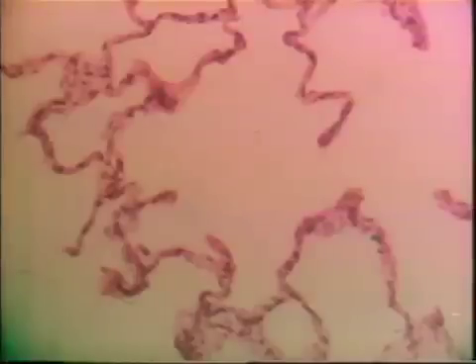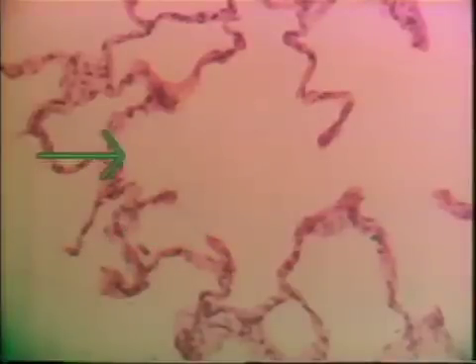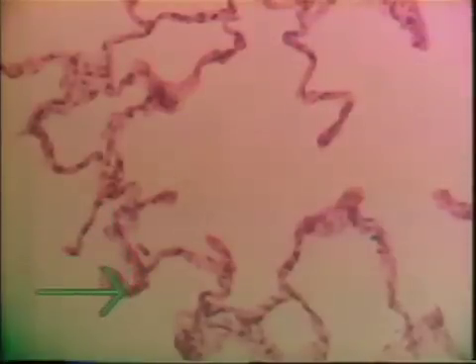At higher power, let's look at the epithelium of the alveolar sacs themselves. These are alveolar sacs, and you have to account for the lining epithelium which is now squamous, and the endothelial cells — because we have capillaries now. The epithelium of the respiratory system is on the periphery, with a huge capillary network in between these endothelial cells. There are also some macrophages and septal cells. This is where the interchange takes place.